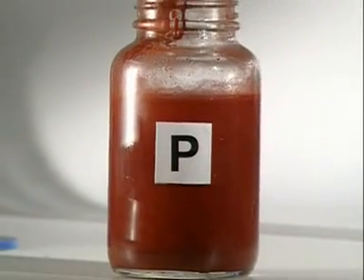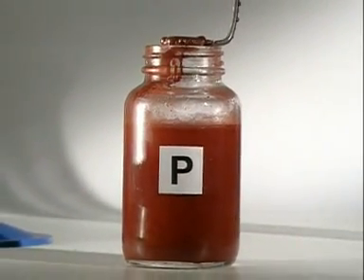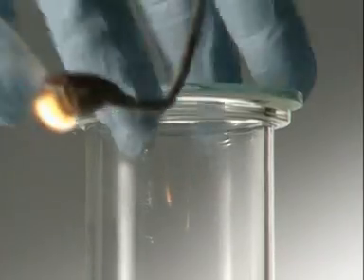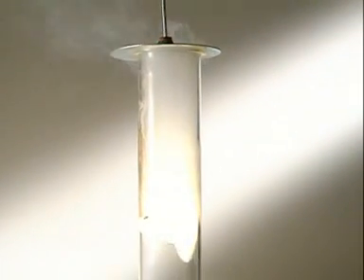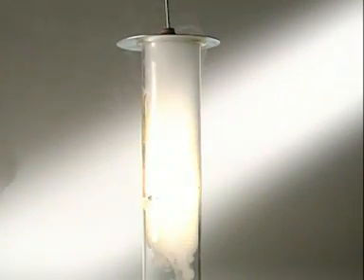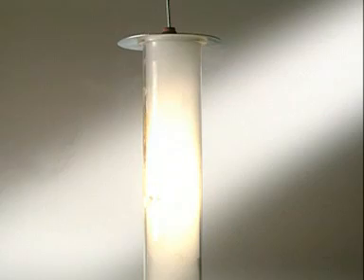Red phosphorus is another non-metal. When it's heated, it ignites. Plunge it into oxygen and it forms a thick white cloud of phosphorus 5 oxide.